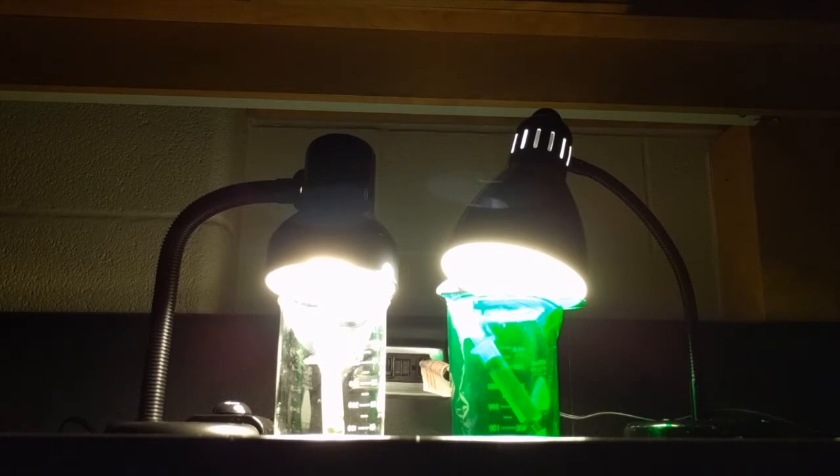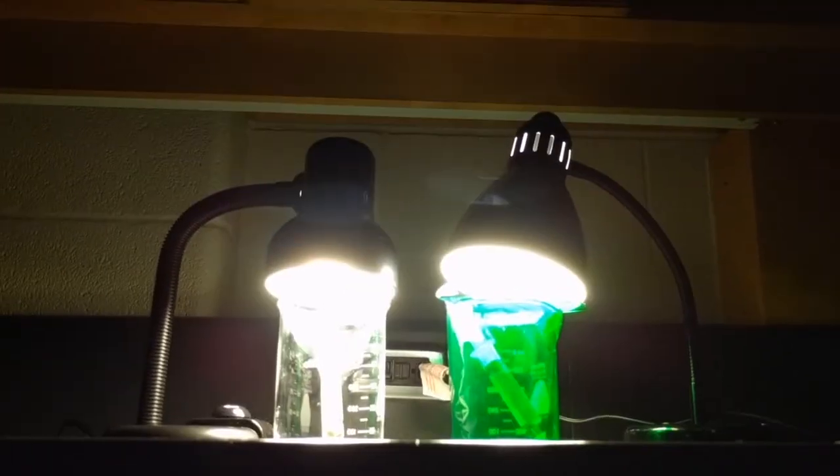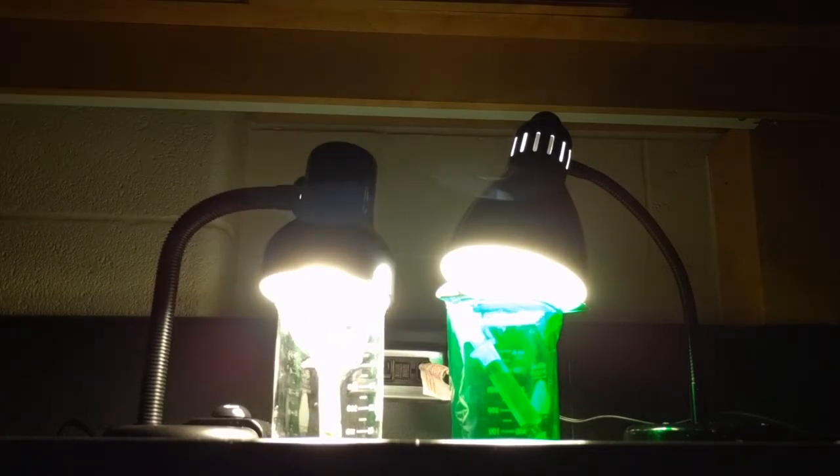The beaker with no filter and just white light contains all the white wavelengths at an equal intensity, meaning the light wavelength ranges from 400 nanometers to 700 nanometers. With wavelengths of both greater than 560 nanometers and less than 520 nanometers, the leaf discs in the white light beaker were able to undergo photosynthesis at a normal rate and rise.